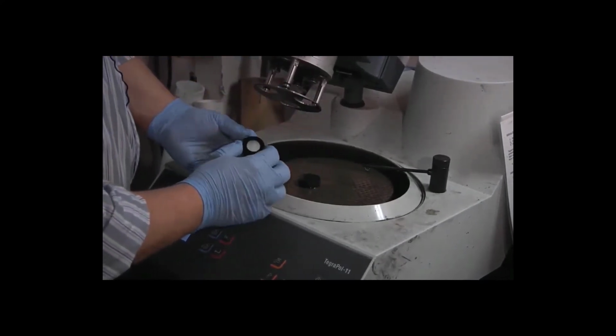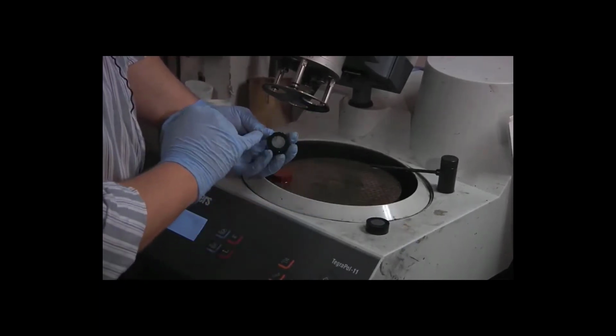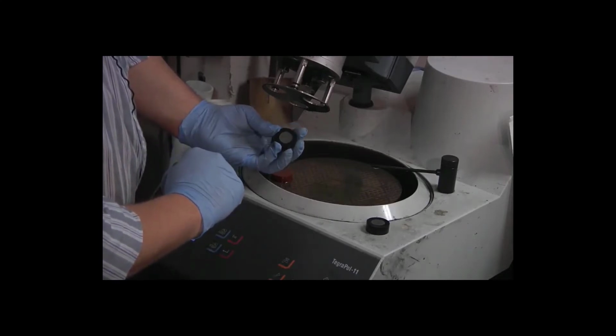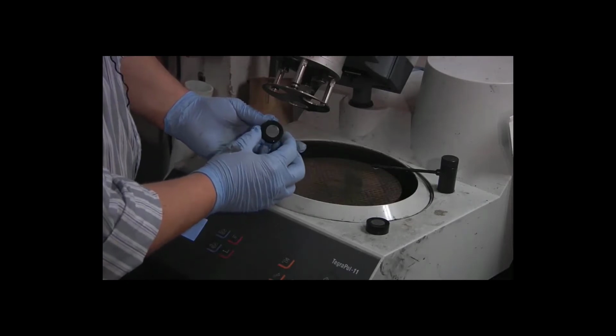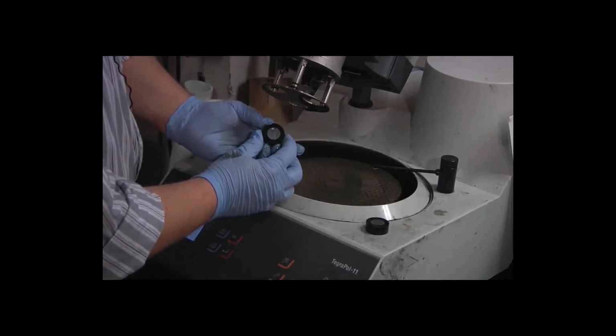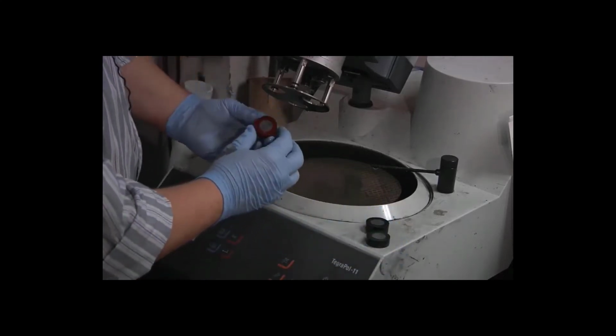Okay, black specimen looks pretty good. The green specimen looks good except for this divot here, but it's relatively small. The rest of the surface looks really good, and we don't need 100% of the surface of the specimen to do our experiment. So I think that we can proceed with this, and we'll just have to avoid that portion of the surface of the specimen.